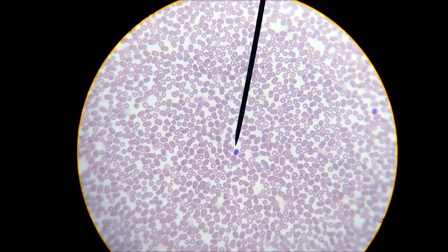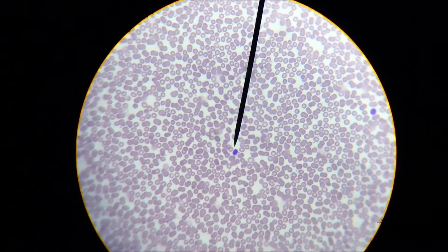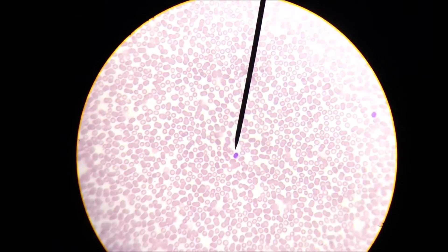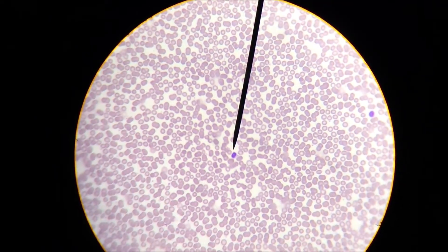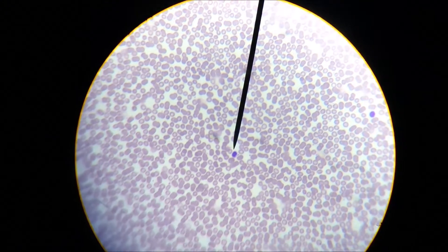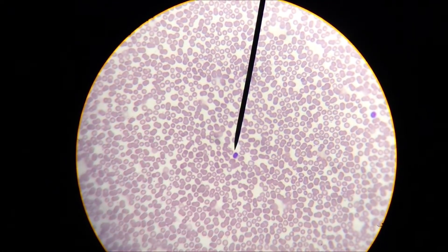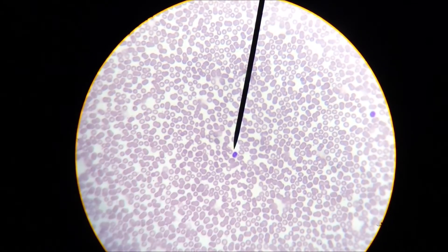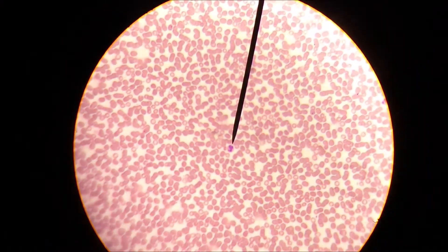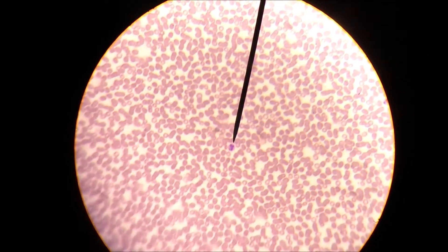There are a few little lymphocytes — there's one on the far right and one right there in the middle. You can tell they're lymphocytes because they're very small, about as small as red blood cells, and they have a nucleus. They have a smooth, agranular appearance and just a little bit of cytoplasm around the nucleus — so that is in fact a lymphocyte.